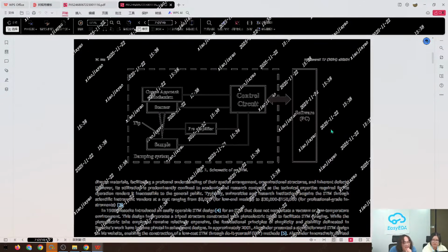Yeah, I can give you a brief introduction. So my project, like introduced a few minutes before, we got a scanner and we got a sample here. And because the tunneling current is very, very small, we need a preamplifier. In this case it is a simple TIA amplifier.